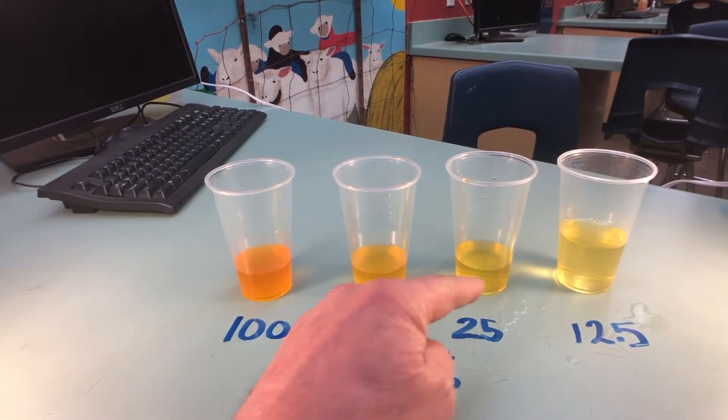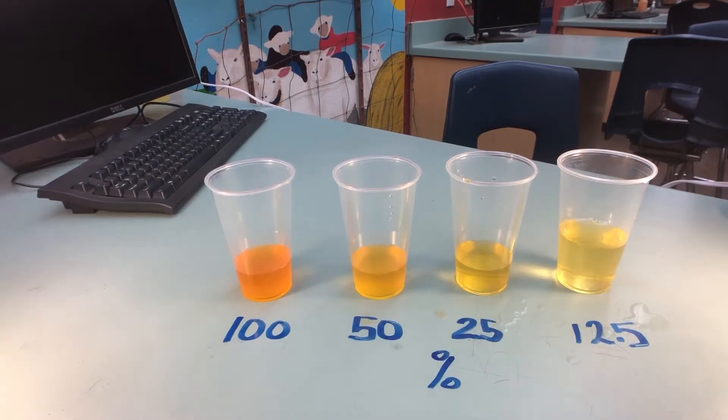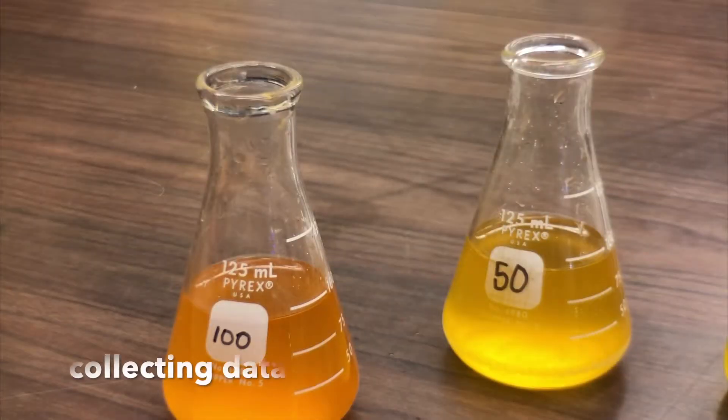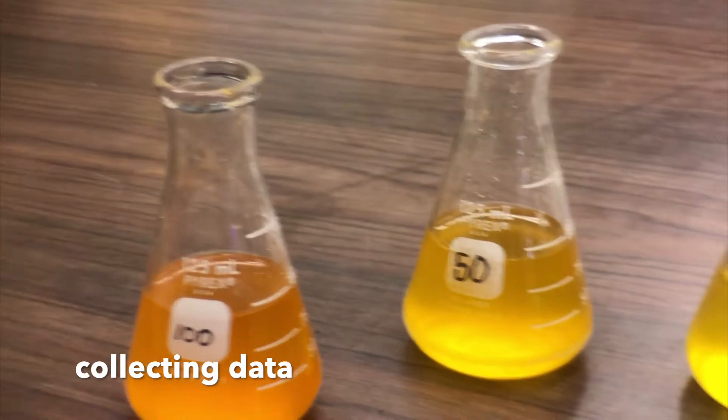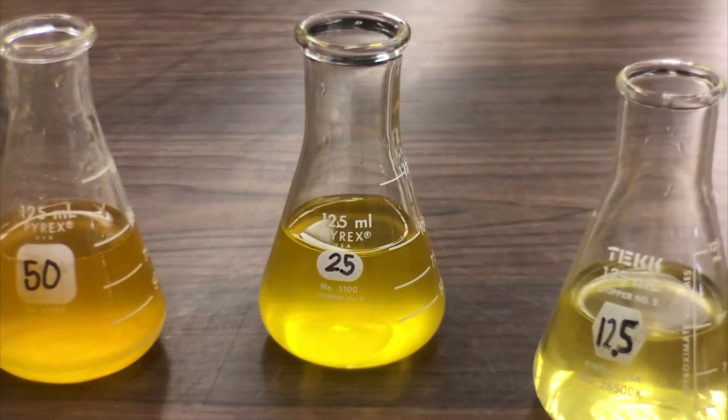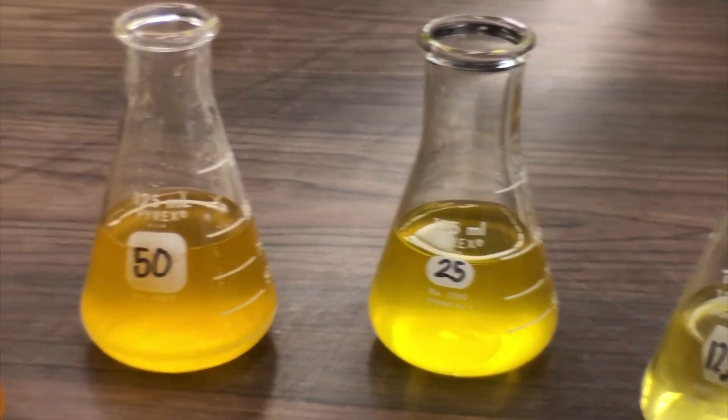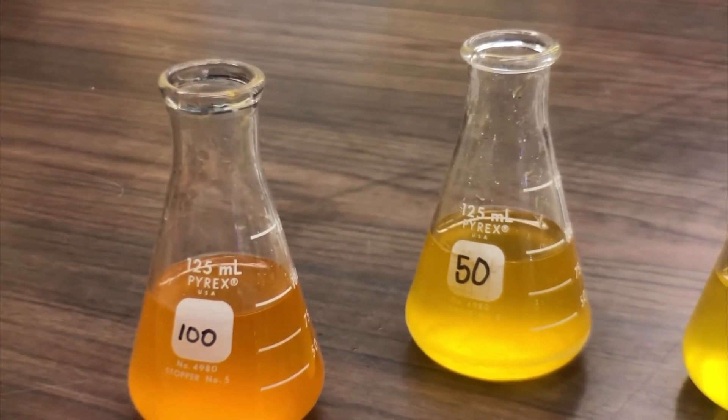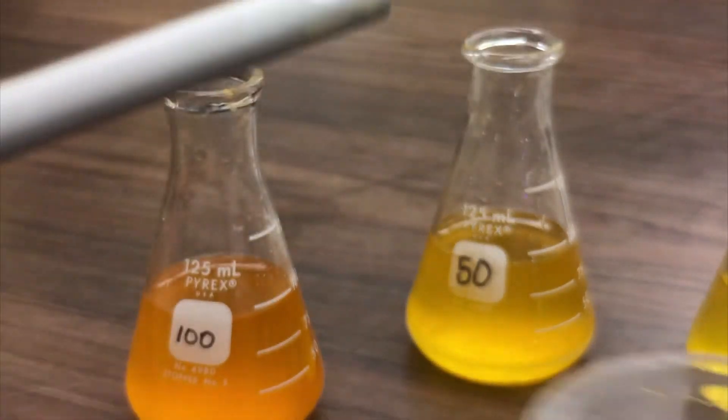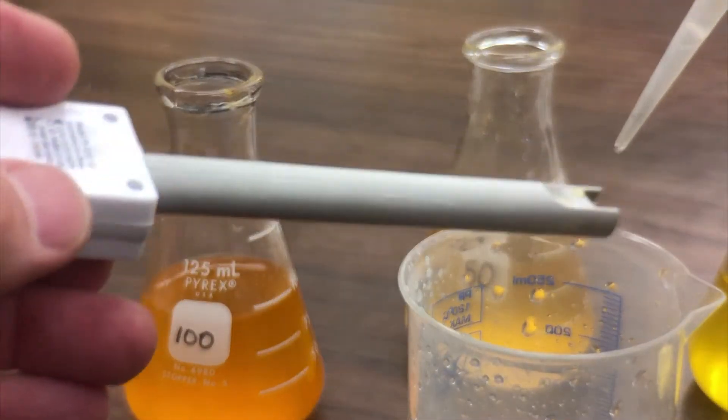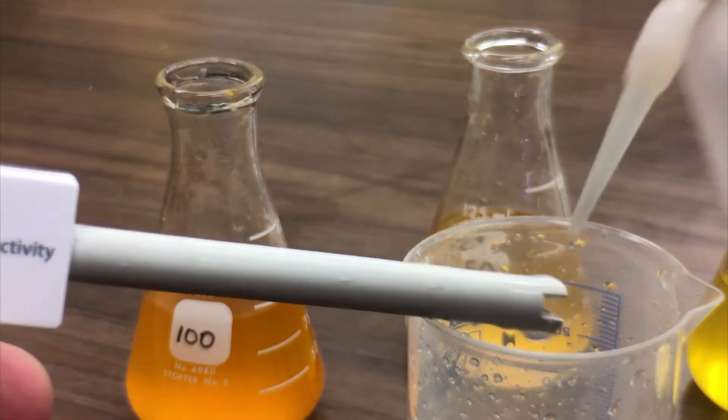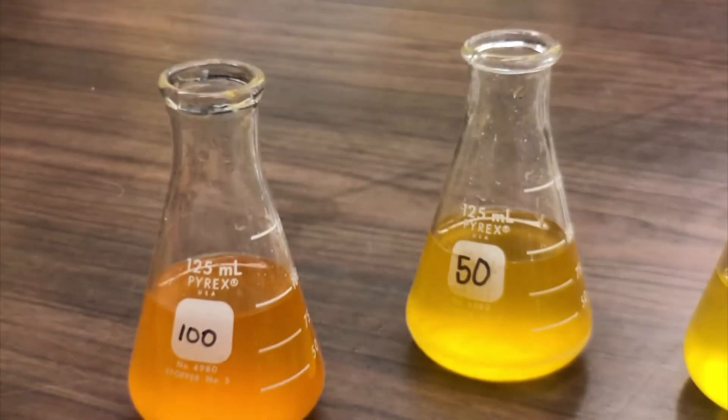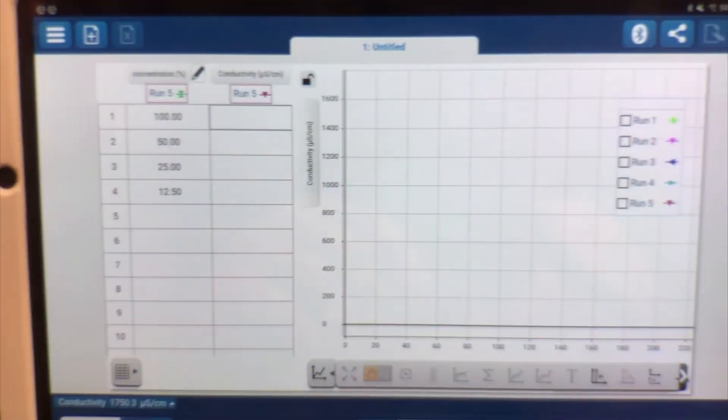We should have 100, 50, 25 and 12.5%. Now we're going to look at our serial dilutions. You can see that they're 100%, 50%, 25% and 12.5%. All of those starting from 100 down is basically 50% of its salt concentration that we have in the sports drink. First before we start our first run we want to make sure that that's nice and clean by just squirting that down into 100% concentration. And now we're going to turn back to our data logger.